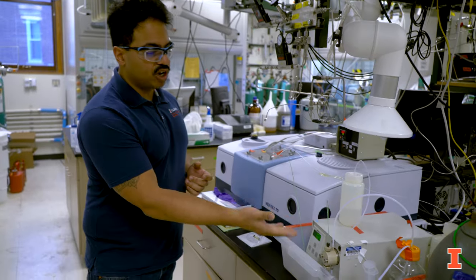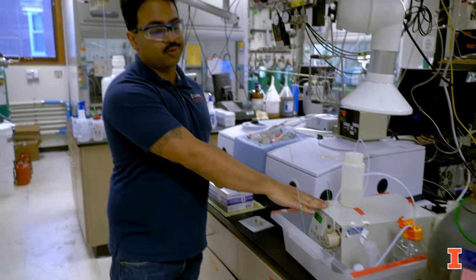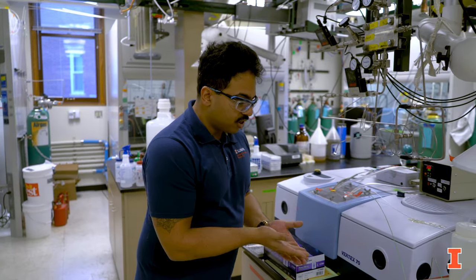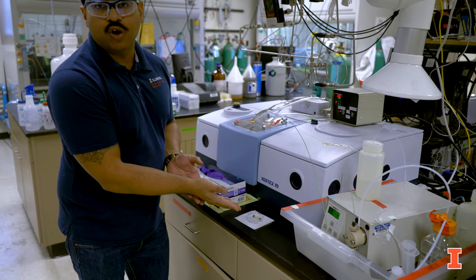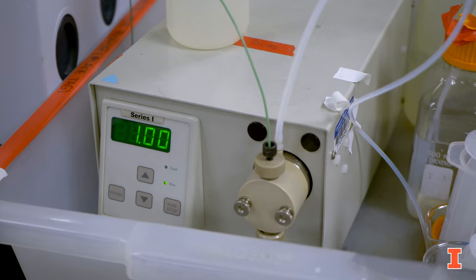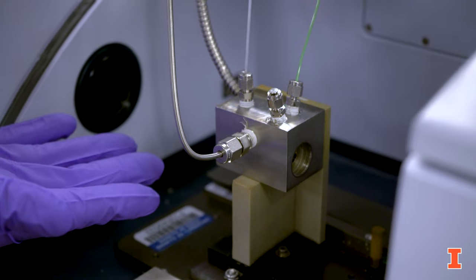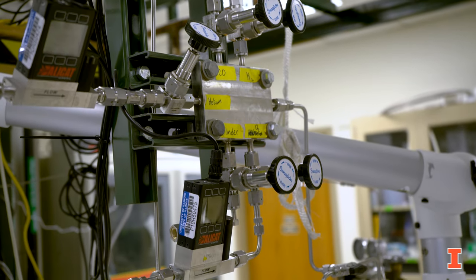Right here, I'm actually flowing solvent using a high-performance liquid chromatography pump through an IR liquid flow cell, where the solvent is flowing over a catalyst and over an internal reflection element. This allows us to further explore and spectroscopically observe changes in the solvent structure as we change reaction conditions of the system.